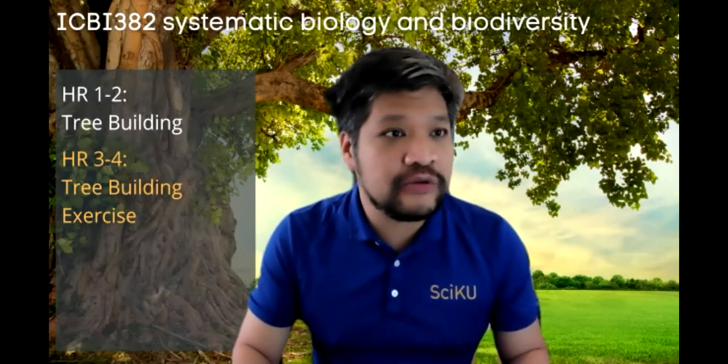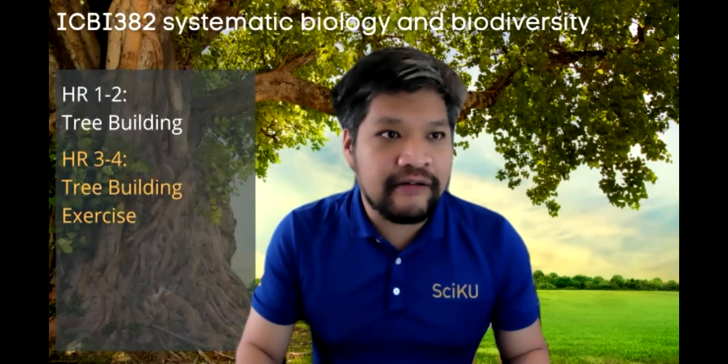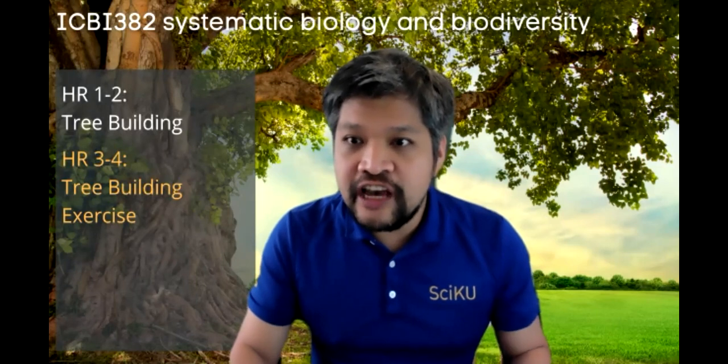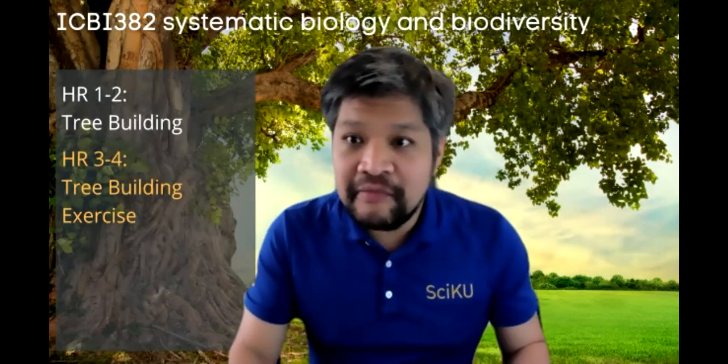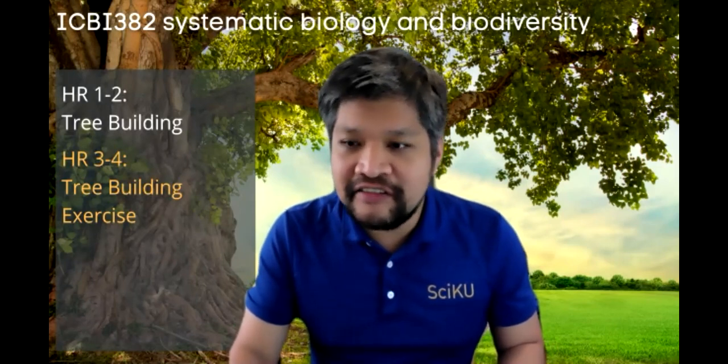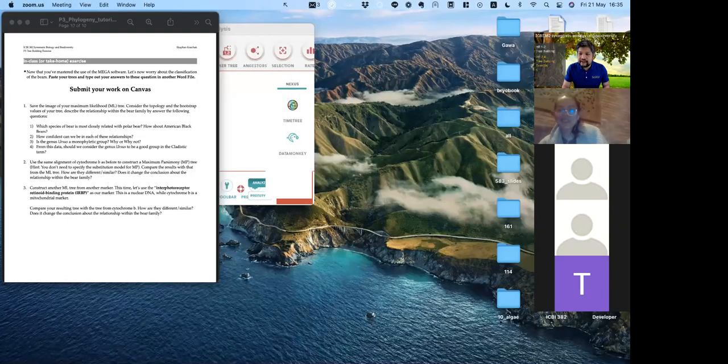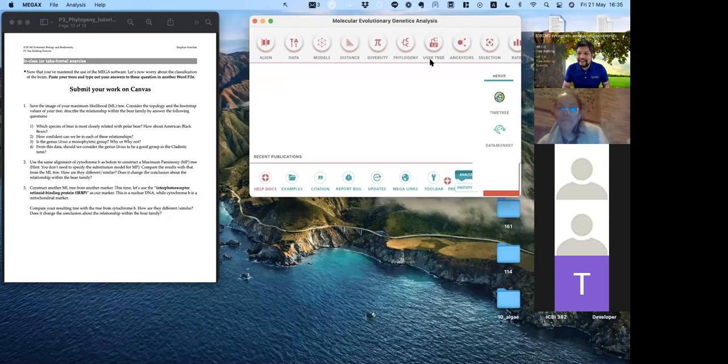I'm going to switch to the program now. For this, I have to share the whole screen, and sorry for my messy desktop. It's going to look sad. This is the most embarrassing part of teaching online, that I can't share just one window, so I'm going to cover it up with other things. Does everyone see my screen okay? The whole screen? I'm going to try to hide most of it.